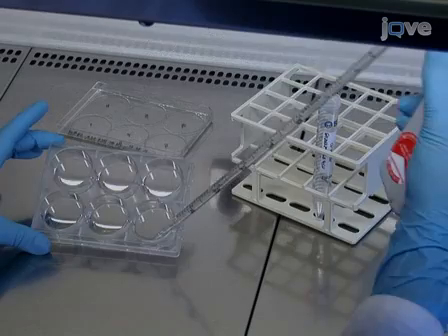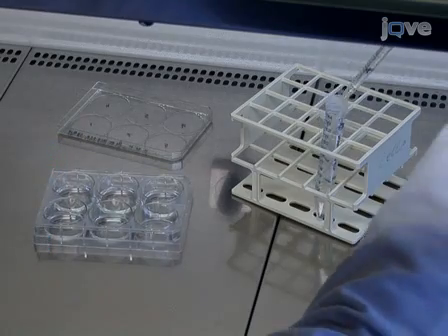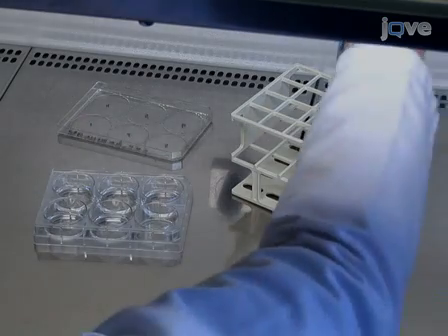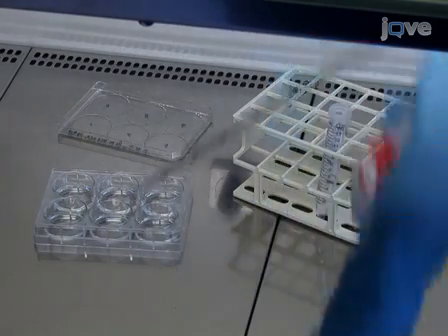The effects of the bacterial treatment can be visualized by fluorescent microscopy, measured by quantitative real-time RT-PCR on the mRNA level, and examined by Western blot analysis. Functional assays like FACS analysis and cell proliferation assays can also be used.